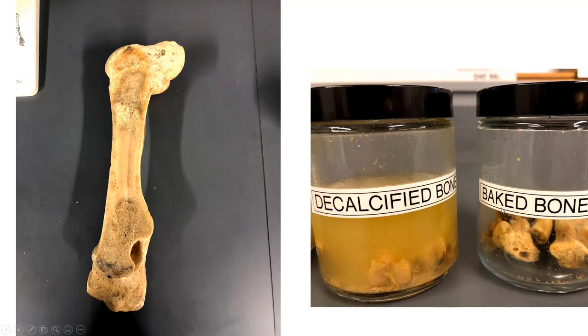Over here, this was an experiment that we usually do in the lab, but basically you take some bones, and by soaking some bones in either vinegar or some other acid-based substance, bone looks like this. So we'll say this is decalcified bone, and this is bone that's just been baked in the oven. So the purpose of this is to show you what the bone looks like if you do one of those things to it. So for instance, if we bake the bone in the oven, that destroys all of the collagen, but it doesn't do anything to the calcium. So the bone's still hard, but it's really brittle. It'll break really easily. And if you look inside this jar, you can see the bone's broken into a lot of pieces.